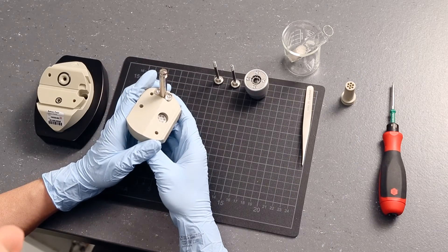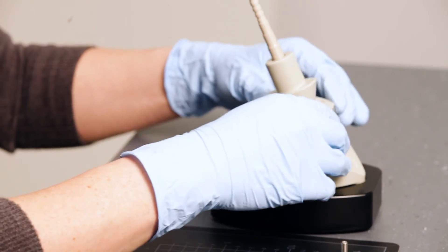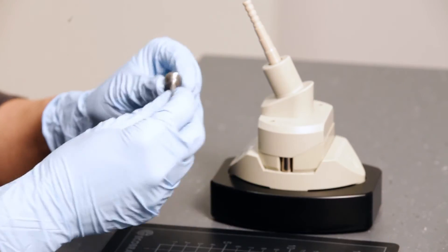Now you can assemble the measuring cell in the same way as for fiber samples, as shown earlier in this video.